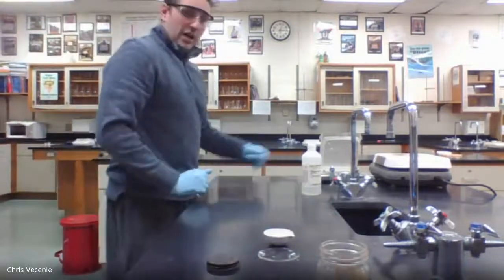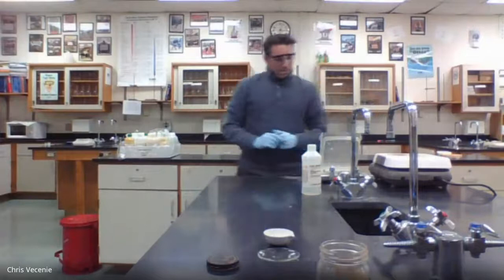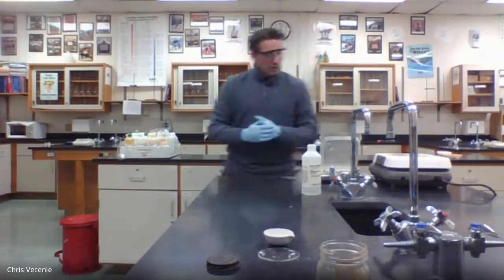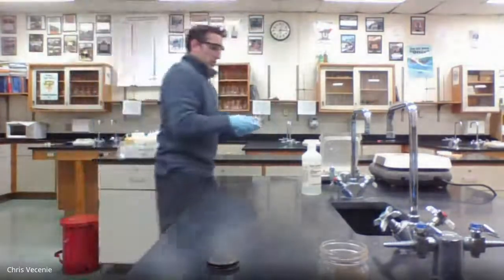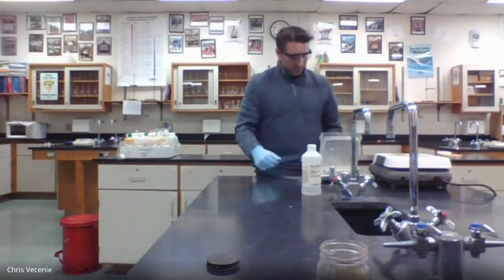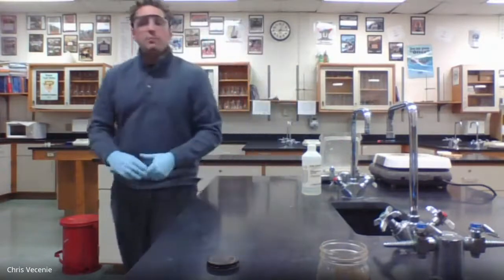All right, so the first thing I'll do is come over here to the balance. Now I'm going to tell you the mass of the empty evaporating dish with its cover so we know what they are by themselves. So put those on up there. That number is reading 53.40.